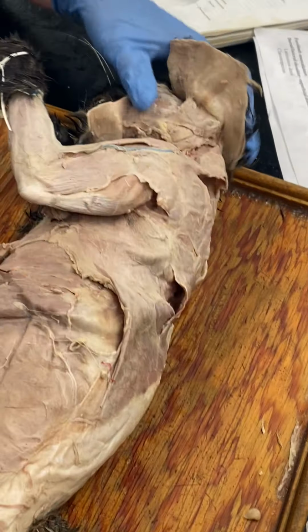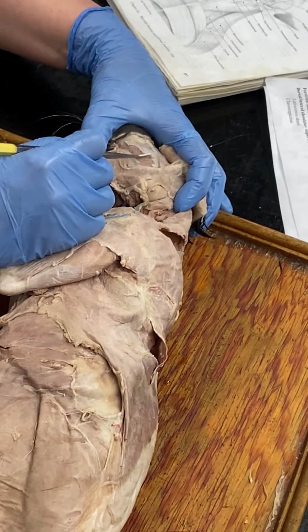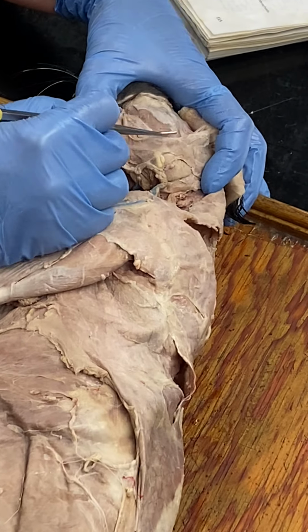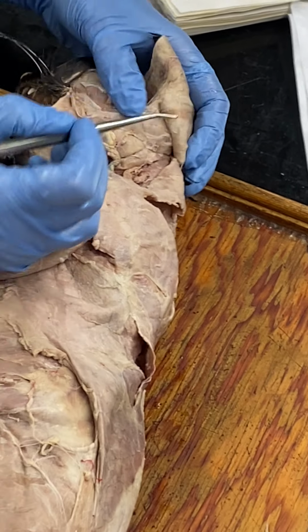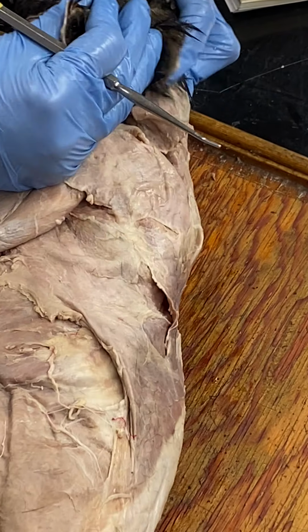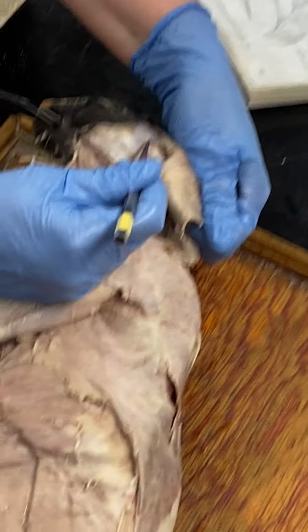Lateral jaw. Okay. The jaw muscles, okay, that's the masseter. Big old masseter there. You can see it's got a lot of connective tissue over it, so you've got a little window to see the fibers. And then up on the top of the head, you got the temporalis.